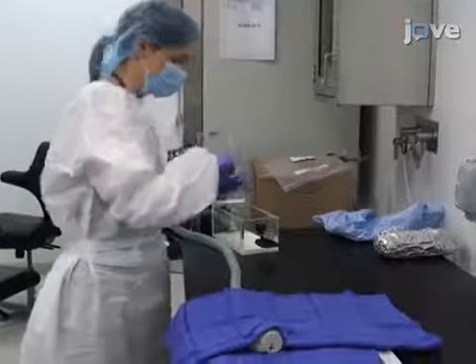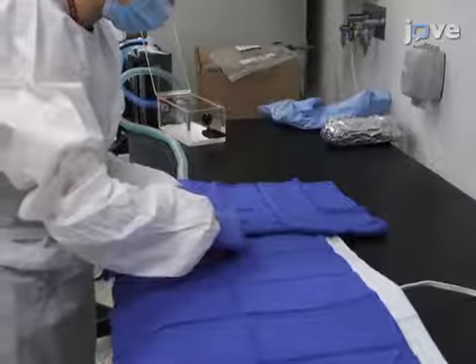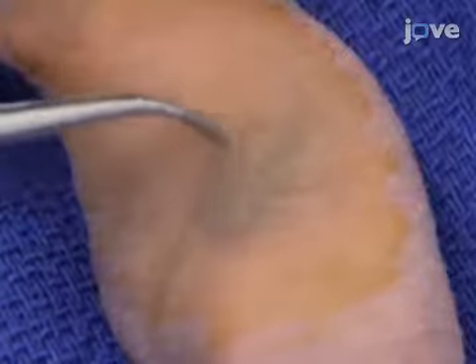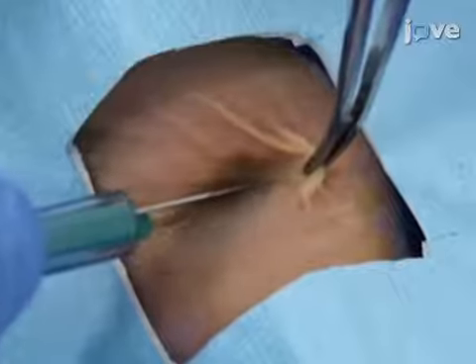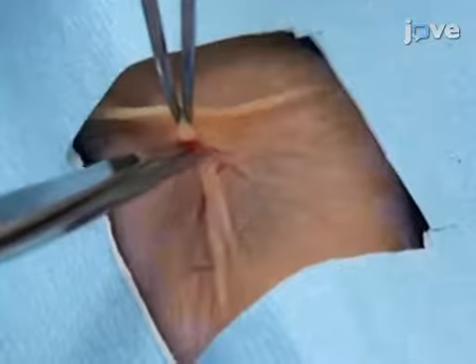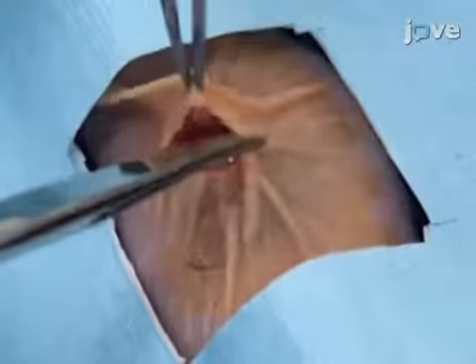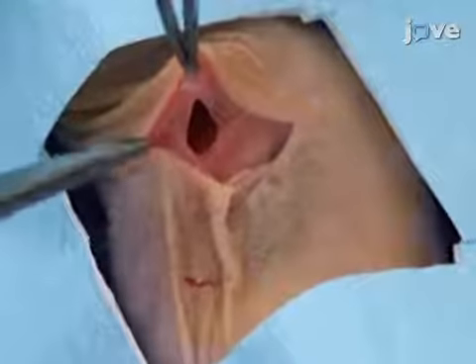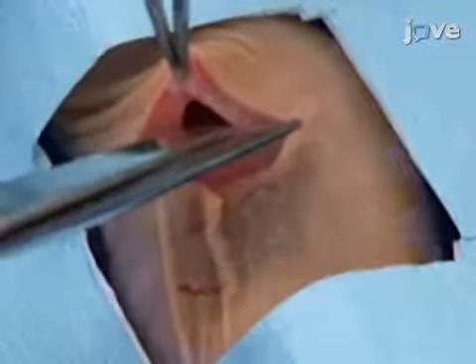After administering analgesics and anesthetizing a 6 to 8 week old female athymic nude mouse according to the text protocol, identify the spleen as a purple area seen externally through the skin on the left flank, and make an 8 mm left flank incision on the skin just above the organ. Next, lift up on the abdominal wall and make a small incision. Allow air into the abdominal cavity so that the internal organs move away from the incision site. Then enlarge the abdominal wall incision to approximately 5 mm.